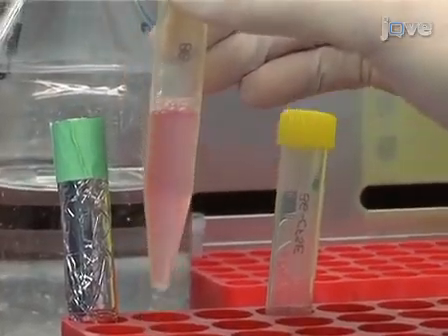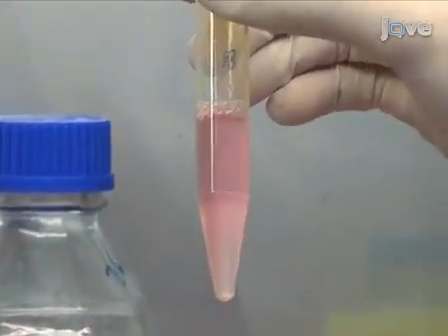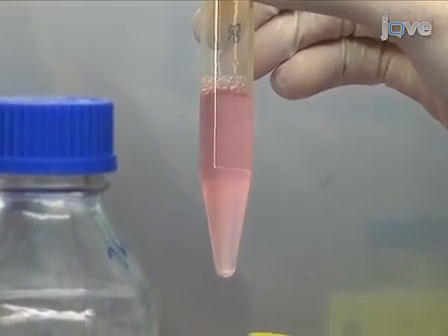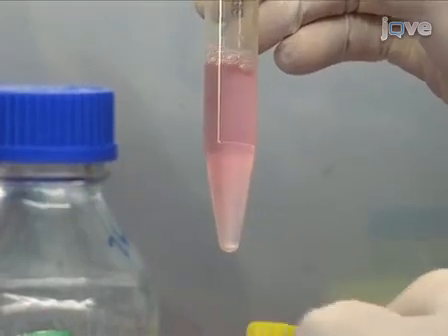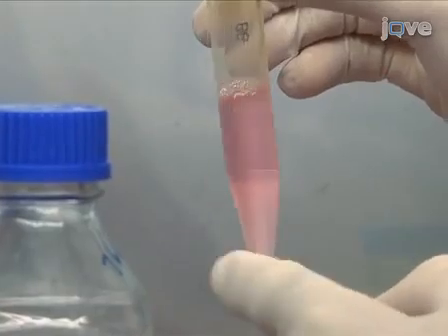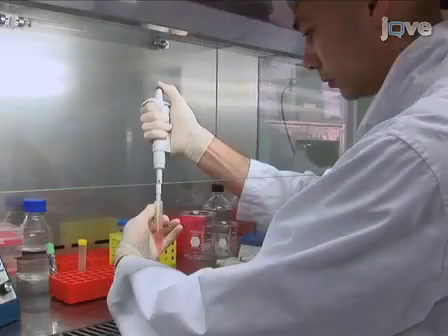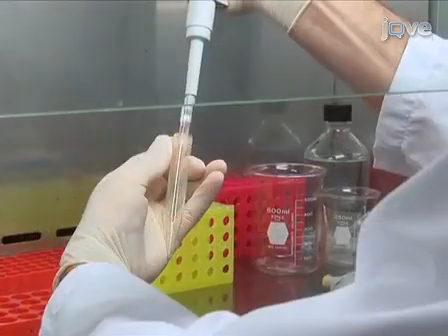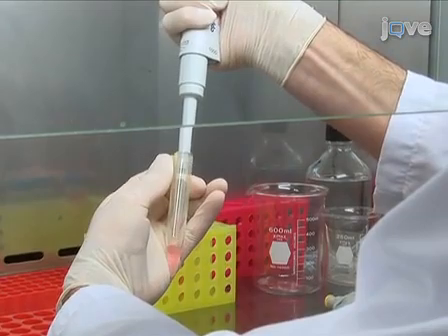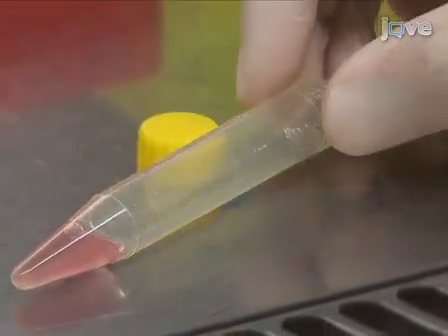In order to label cells, begin with freshly isolated lymphocytes from spleen or lymph nodes of mice and add them at a concentration of between 0.5 and 10 million cells per milliliter of culture medium, supplemented with 5% heat-inactivated fetal calf serum. Thoroughly resuspend the cells and carefully transfer 1 milliliter to the bottom of a fresh 10 milliliter conical tube. Lay the tube horizontally.